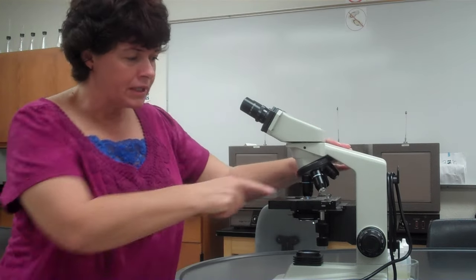Now that I'm focused on the 40x, I can go to the 100x — but you must use oil immersion; it is not optional. Without oil you may see something blurry, and it will either be the wrong color or always out of focus. You must use oil immersion to decrease the refraction of light to get a clear, correctly colored specimen. For a gram stain, you're distinguishing between pink and purple — without oil it may appear pink, but the correct answer might be purple. The only lens that can ever have oil on it is the 100x. Getting oil on the 40x or 10x will permanently damage the microscope.